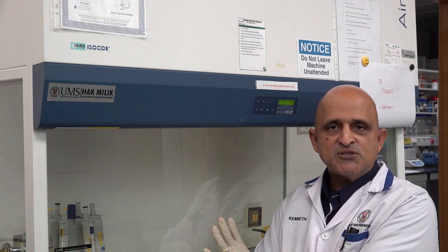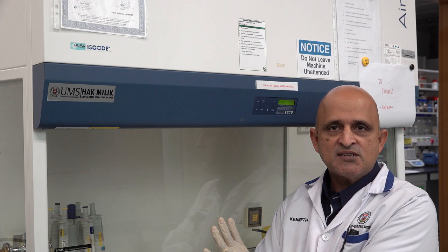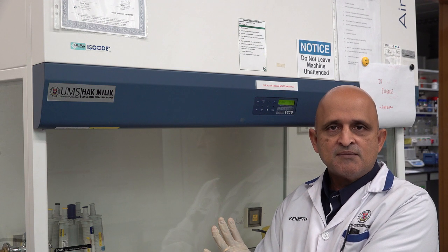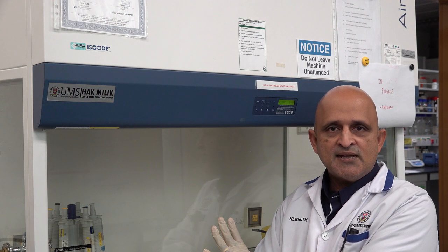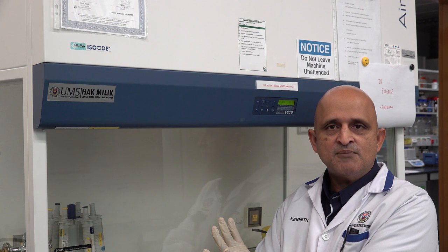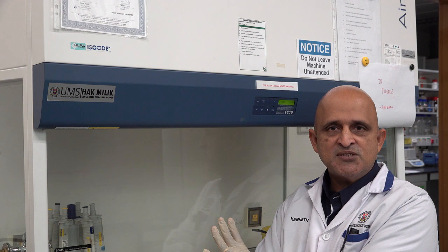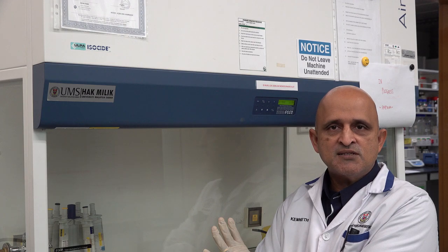As we proceed in this module I will introduce you to the standard operating procedures for this particular biological safety cabinet. Please take note that the procedures may vary based on the manufacturer and you will have to develop your own standard operating procedures and validate them prior to commencing operations in biological safety cabinets.